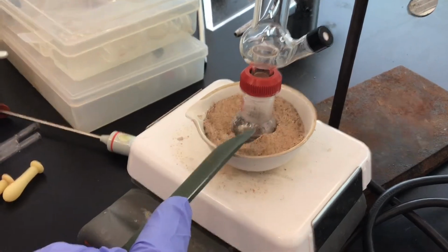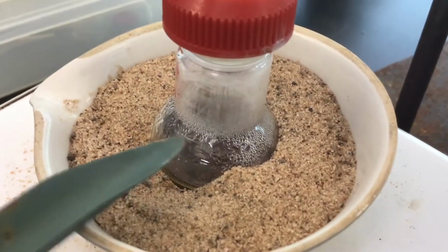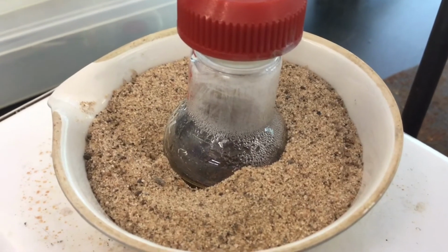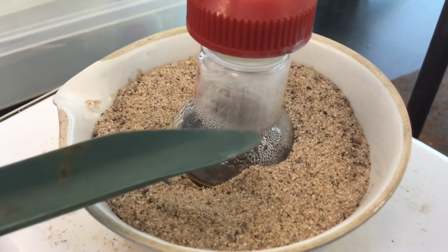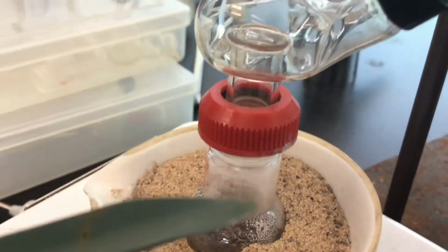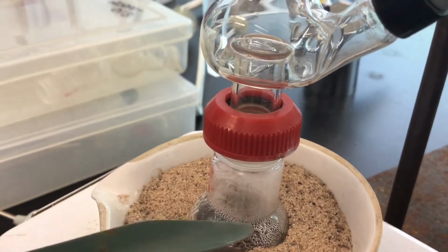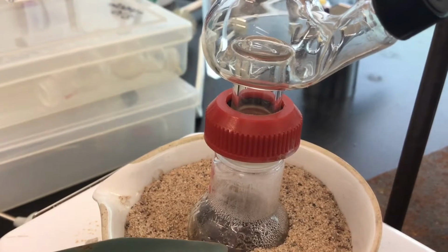And so if we get a nice closer-in picture here, we see that we've got water condensing. Right, so it's definitely starting to heat up, it's steaming. And essentially what we're going to wait for is for this to boil and heat this part of the glassware that's going to travel upward to the Hickman-Hinkle stillhead. Because what's going to happen is that as the steam is traveling upwards, it's going to condense on the cooled glass and then come back down.